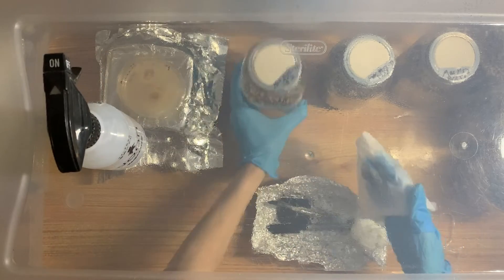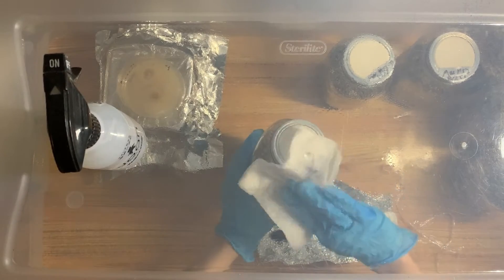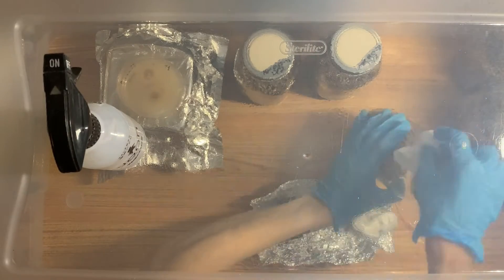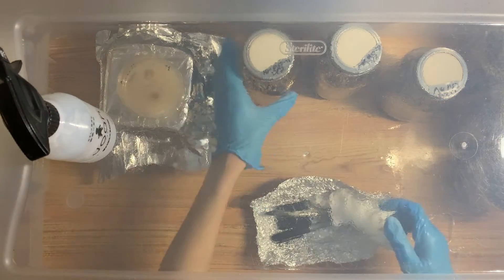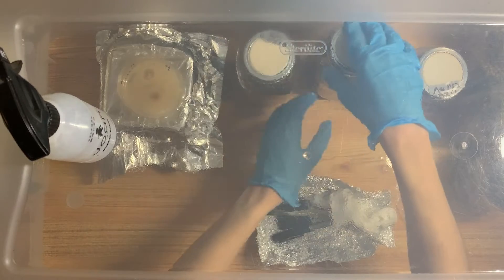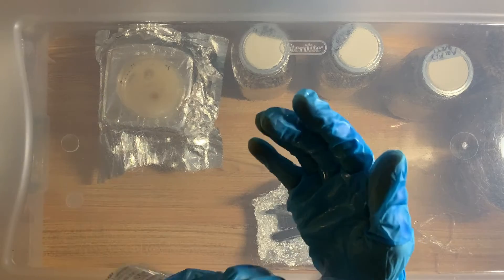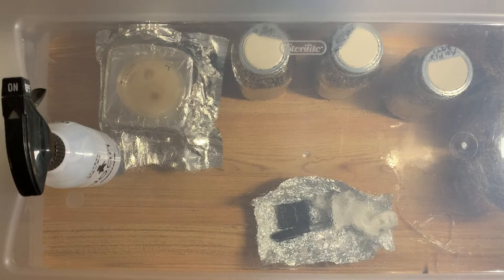We're going to spray the SAB again and wipe the lids again, making sure I don't touch the marker writing because it'll wipe off. Just to be sure, I'll wipe it down again, put it to the side, and wipe down my hands. Then we're going to unscrew the lids a little bit — just for easy opening and closing when I have the wedge in one hand, because you want to do it quickly, smoothly, and fluidly. It can be a bit of a balancing act with a wedge on the scalpel, but thankfully this time all six went very smoothly.